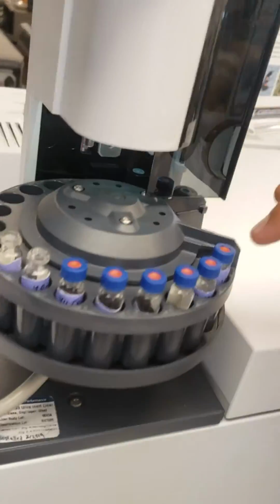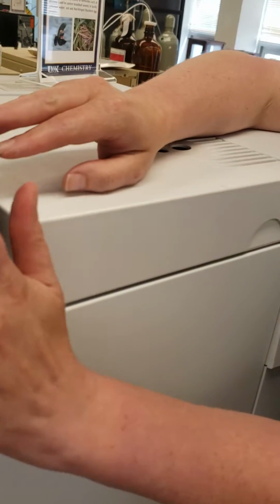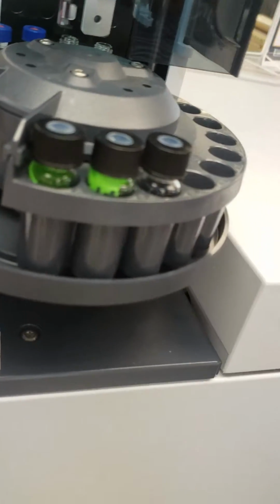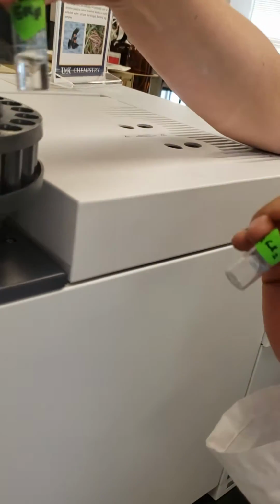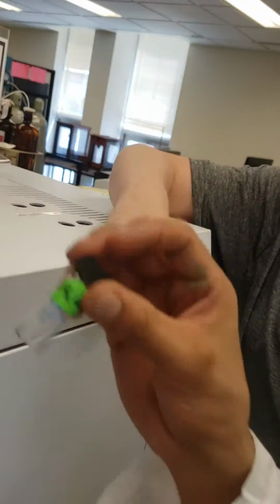So if I want to run, for example, my washing will be number 1? Nope. Washes come here with wash A, wash B, and vial W is where it disposes the washes. Do people here have some solvents? They don't have anything in here. They probably did at one time. The dichloromethane that they were using has evaporated out. Yeah, dichloromethane is the one we will use.